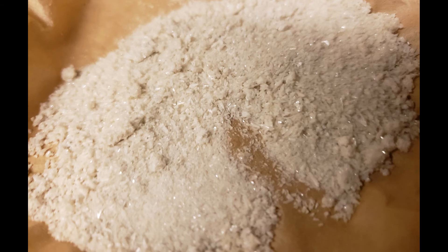After an overnight air drying we obtained 7.37 grams or about a 67.2% yield. When the melting point was tested it was a perfect 170 to 172 degrees celsius. The product is nicely crystalline as expected.